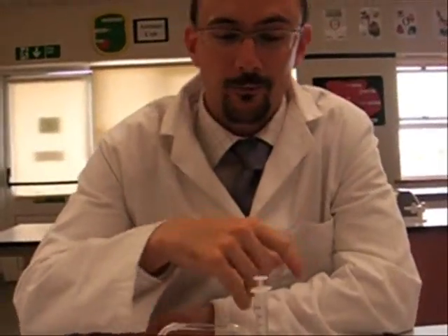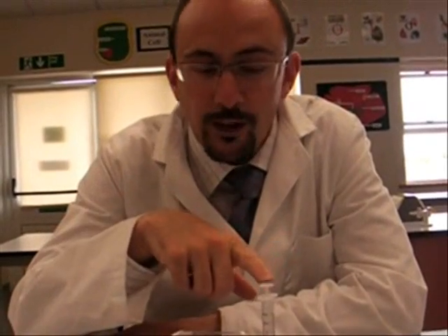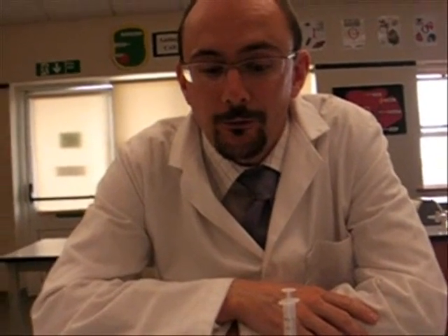Okay folks, so that's it. We're going to be judging you on how well you get the copper oxide powder into the glass tube, if you can tell us the name of the gas that's being made, and also if you can tell us the reaction that's helping the copper to be made at the end of the reaction. And also how well you've managed to make the copper. And that's it.